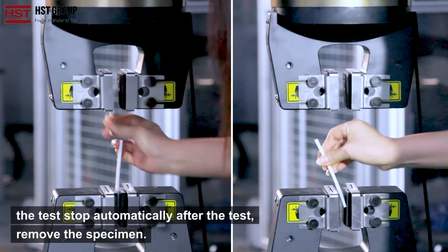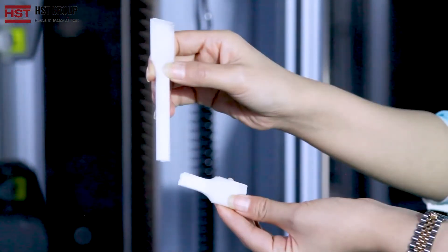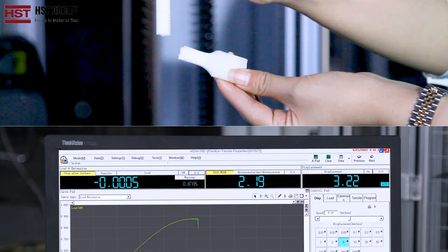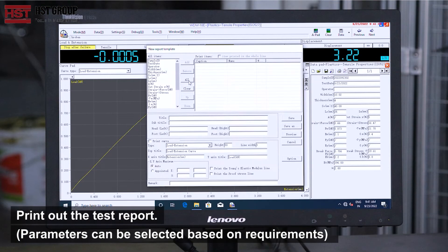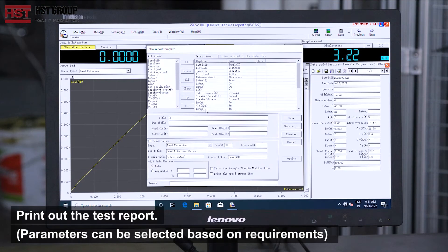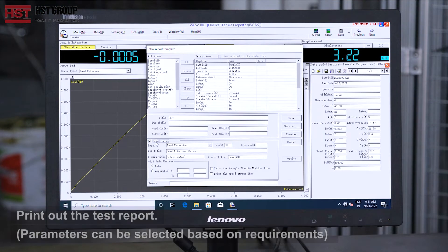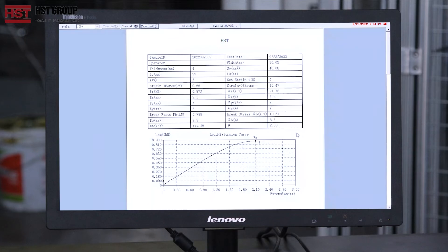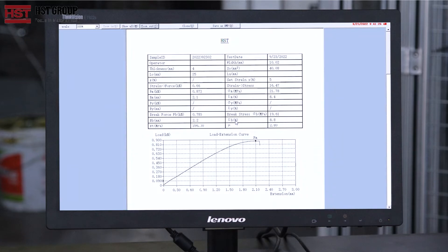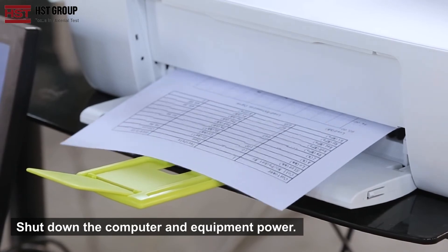Remove the specimen and print out the test report. Parameters can be selected based on your requirements. Then shut down the computer and equipment power.